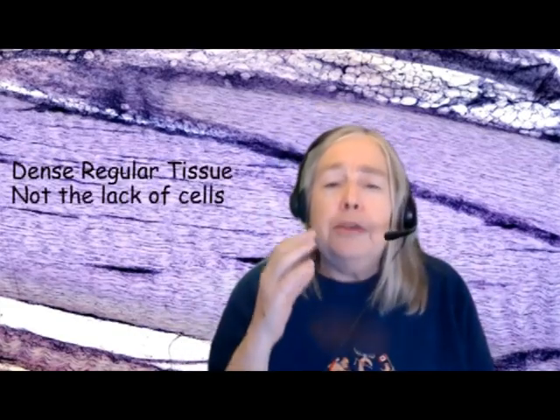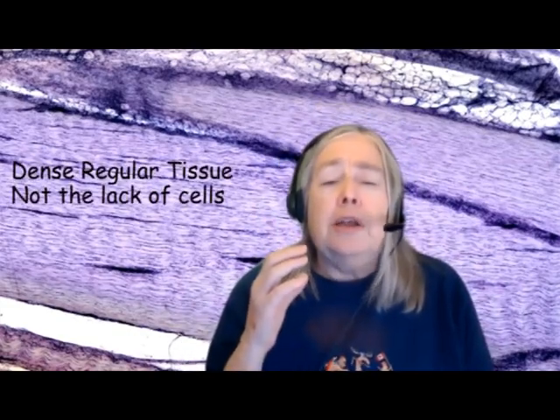Please ignore color on slides — don't try to learn things through color. I know it's tempting, but the colors are just an artifact of the dyes being used. This is also tendon, and you can see the fibers going nice and smooth across the tendon, laid down in a very regular array. We call this regular connective tissue. It's also dense — meaning the fibers are packed in like sardines — with a few cells in there helping to maintain it. So this is dense regular connective tissue from a tendon.